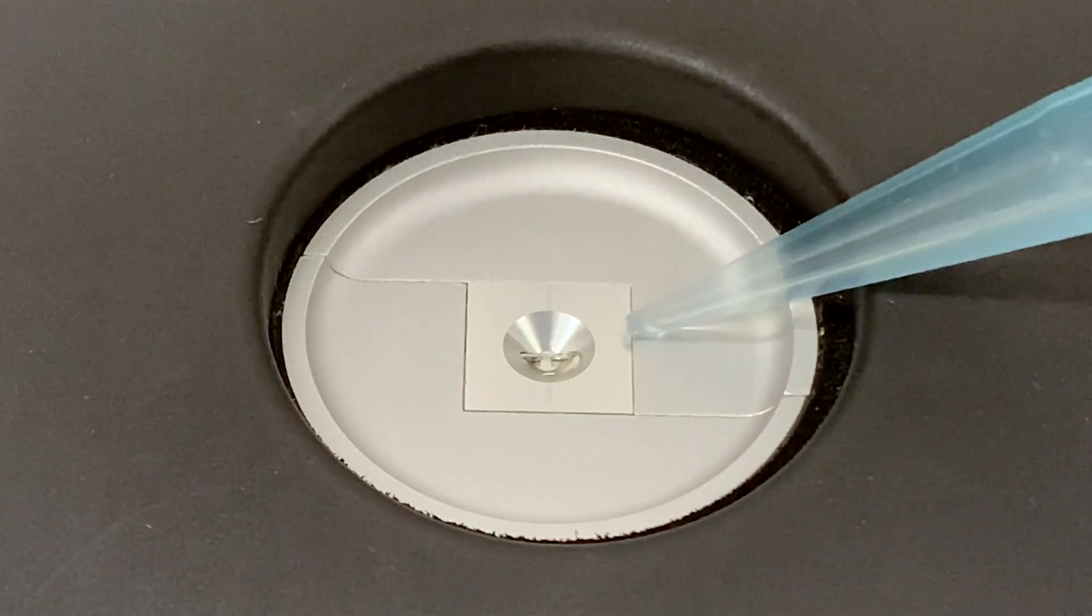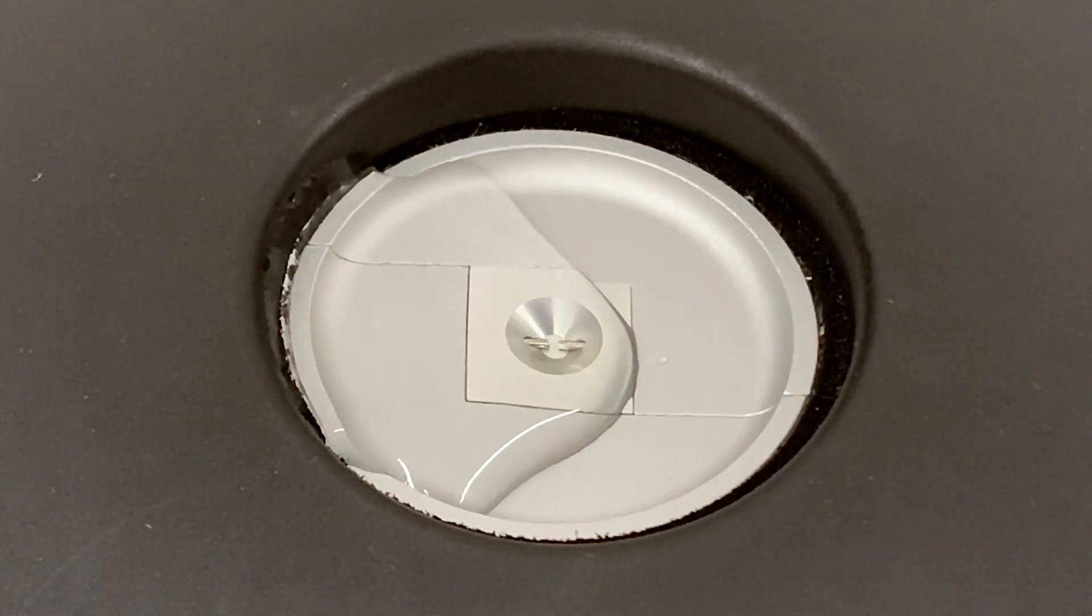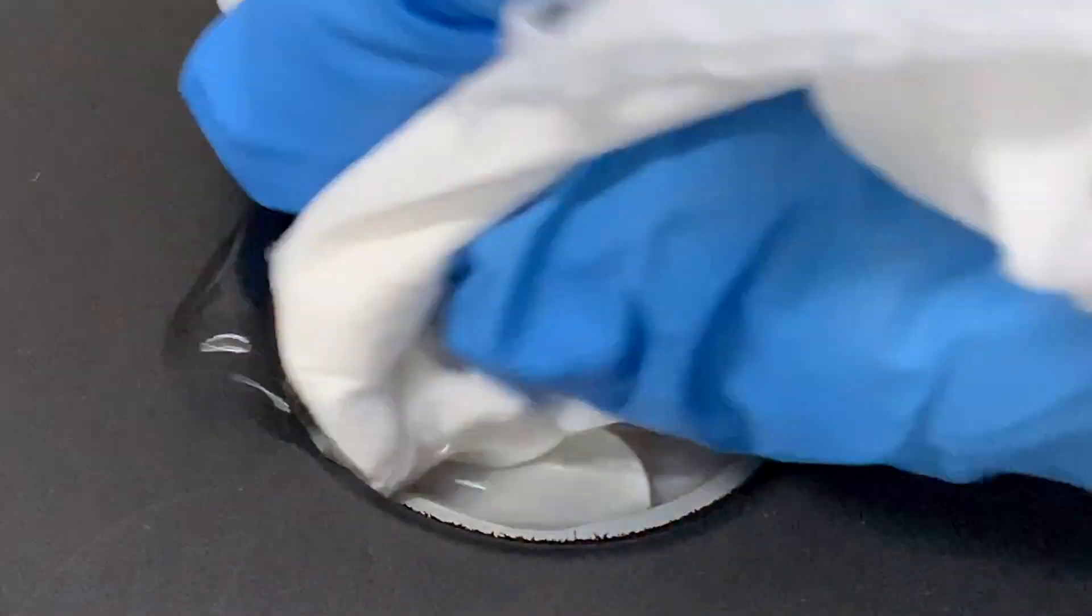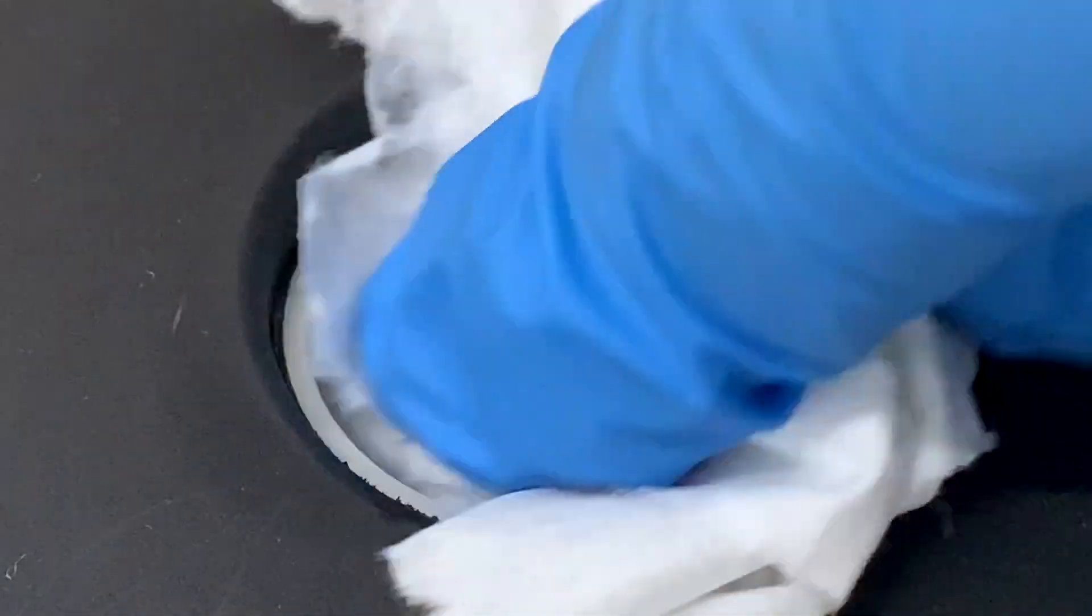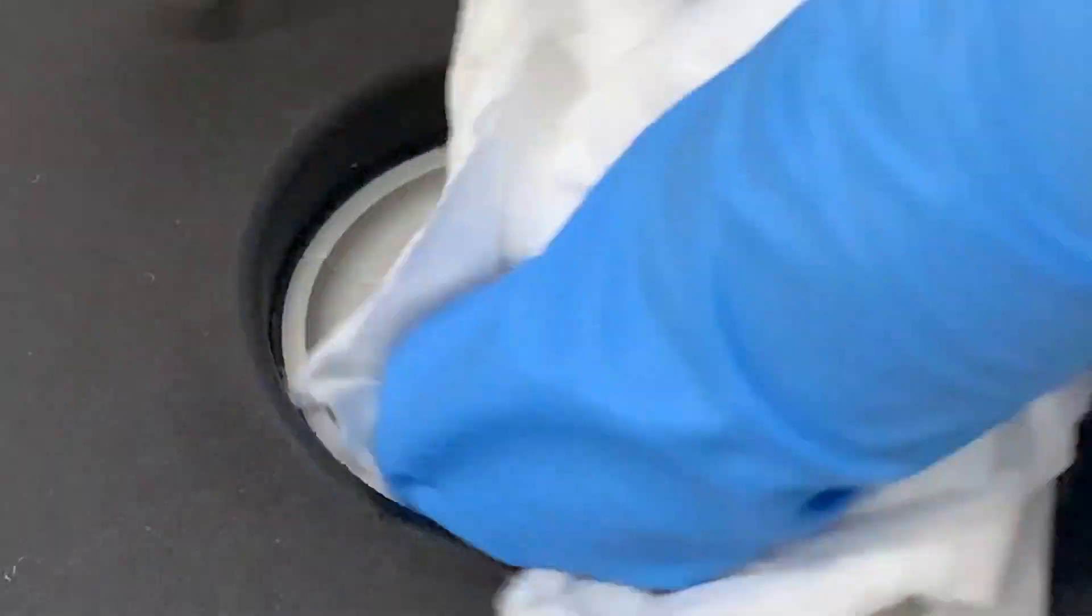Finally, to cleaning the microvolume sample port. The instrument itself has a sealant so penetration of liquids is never going to be an issue, and the fiber optic pins are incredibly robust so there should never be any issues with cross-contamination.